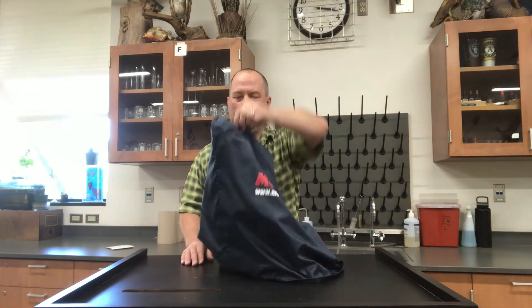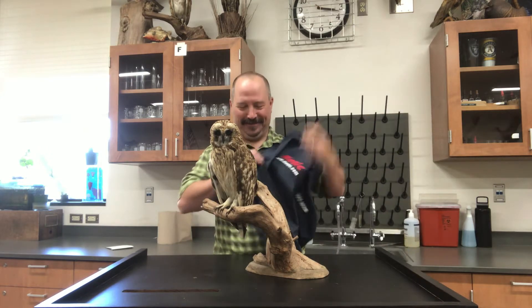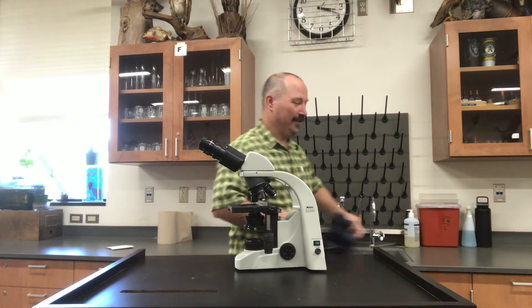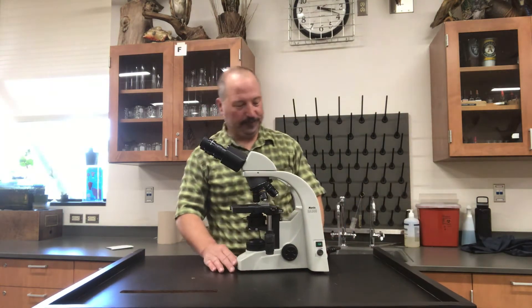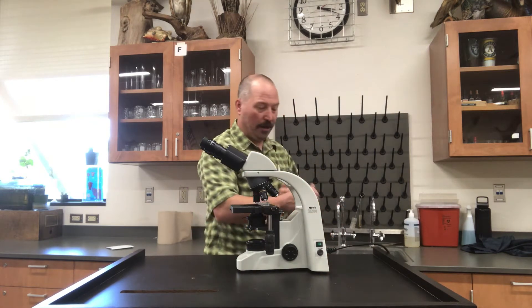So you've brought your microscope back to your table. Make sure it lies flat. Then what you'll do is take off the dust jacket. So you've got the dust jacket off, and you want to plug it in to your power source.